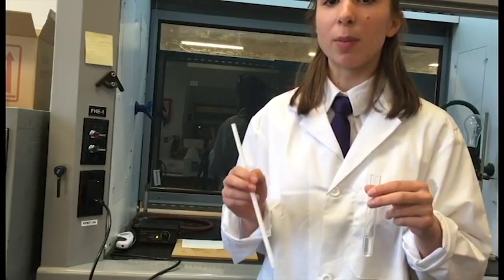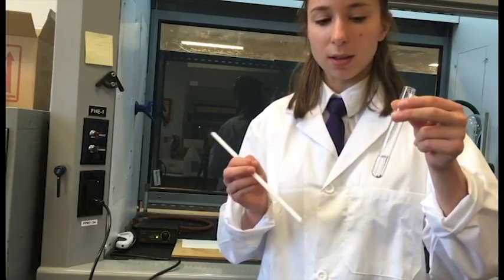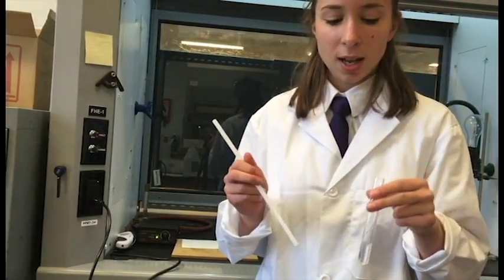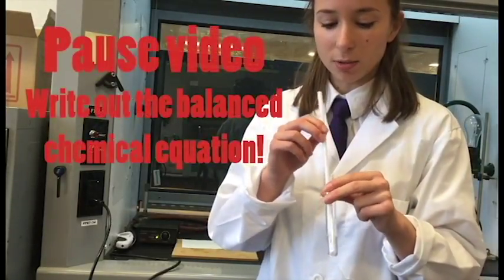Here we have lime water, which is calcium hydroxide, and we're going to bubble CO2 to form a white precipitate, which should make this solution look milky white. So this is what it looks like right now. It's just transparent, and we're going to see what happens when we add some CO2.